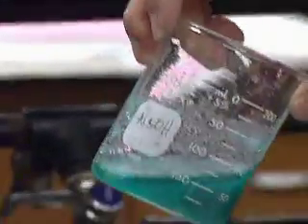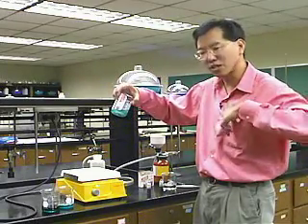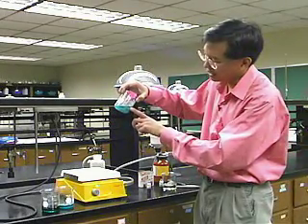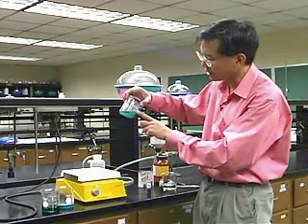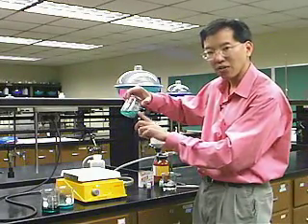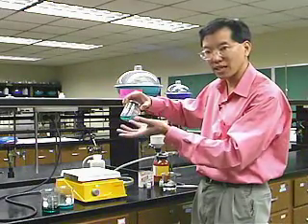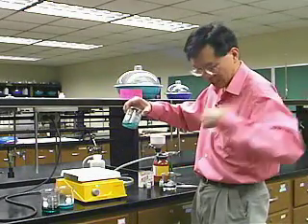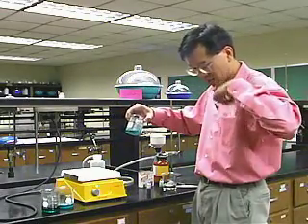Now, the crystals are not as nice as these crystals, but they're still nice crystals. The point that I want to make is that if we have been able to effect a purification here, then when we collect the crystals, the food coloring ought to go with the water, and so the crystals ought to come out perfectly colorless again, just as the crystals of the sugar are perfectly colorless. So let's take a look.